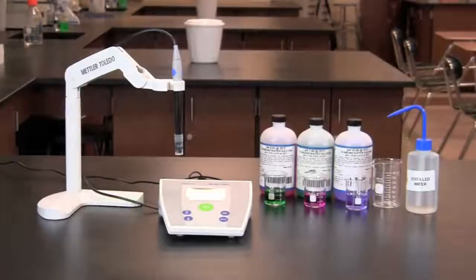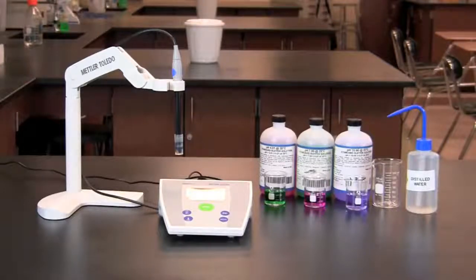In this video you will learn how to use a pH meter. pH meters can be small and handheld or larger stationary pH meters. In this video we will be using a stationary pH meter.